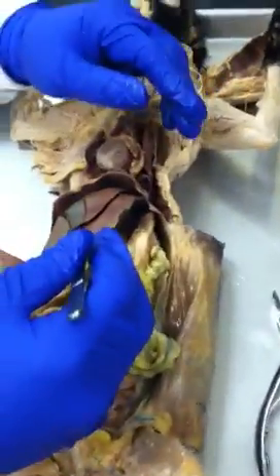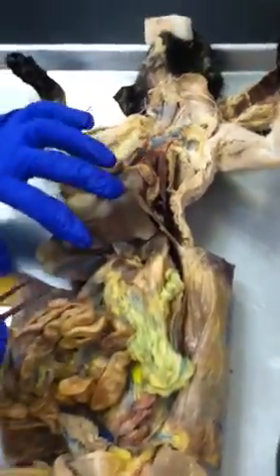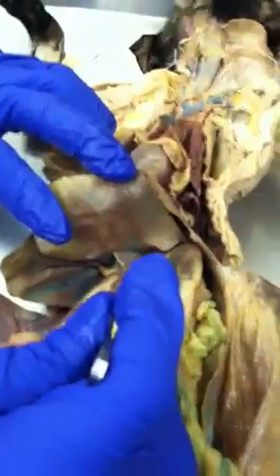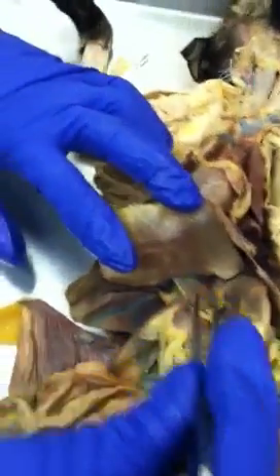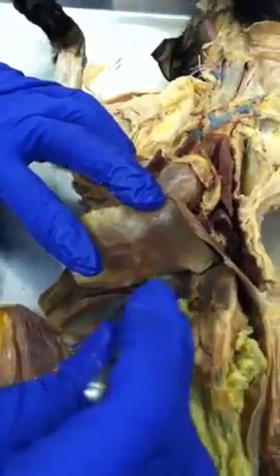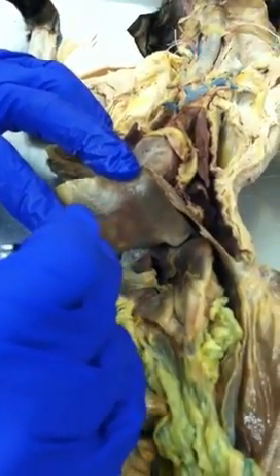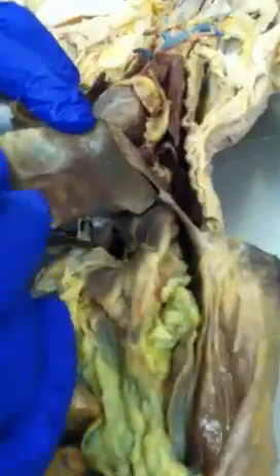Now, the liver of the cat is slightly different. It's majorly different from that of the human. If I go like this, I'll expose this one that's pointing, a little pointy thing here. That will be the caudate lobe of the cat liver, all right? So the caudate lobe of the cat liver. And I can get that connective tissue off to really expose it. Do you see how I'm exposing it? You see it? Right there, caudate lobe.